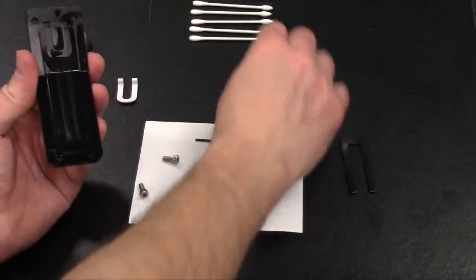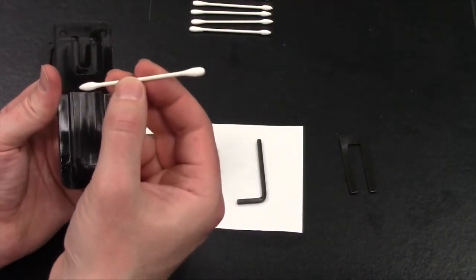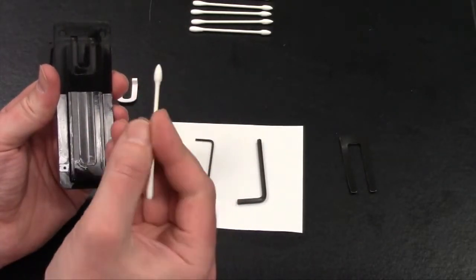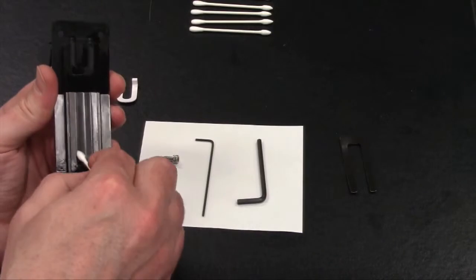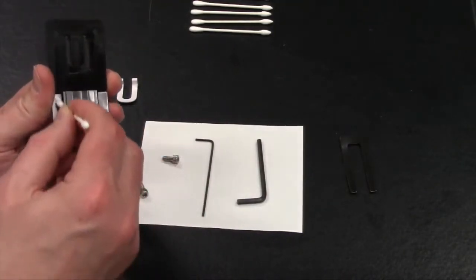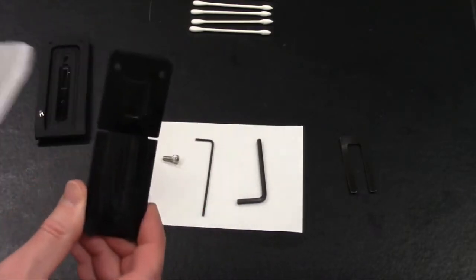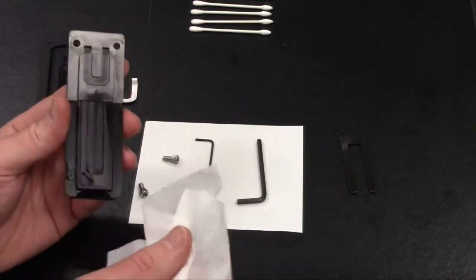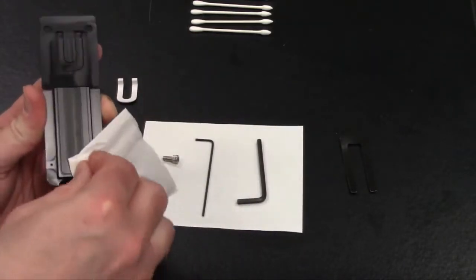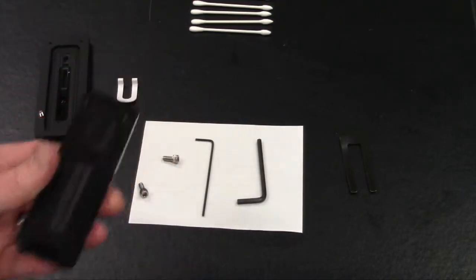At this point, you can also use one of the supplied swabs. You'll see one end is rounded where the other end has a nice pointed tip that will allow you to try to get into the different crevices and use this to clean a little bit better. If you also have the same lint-free Kim wipes or some other type of lint-free cloth, you can use that to clean and dry off any residue from the lid itself.